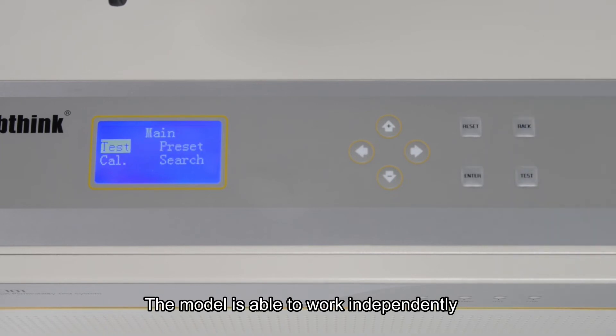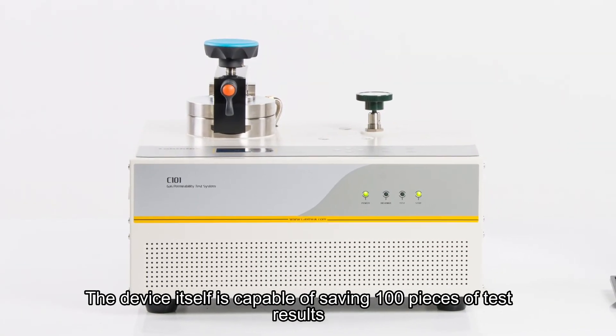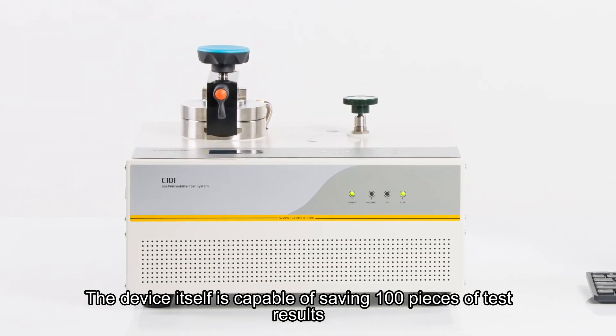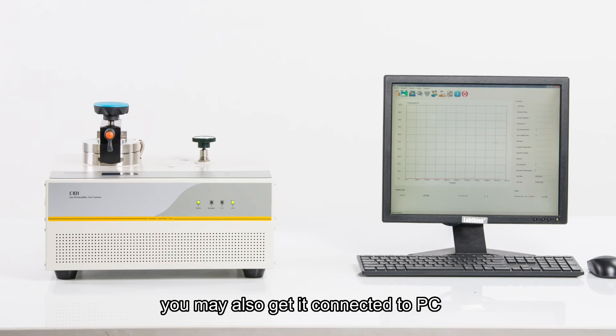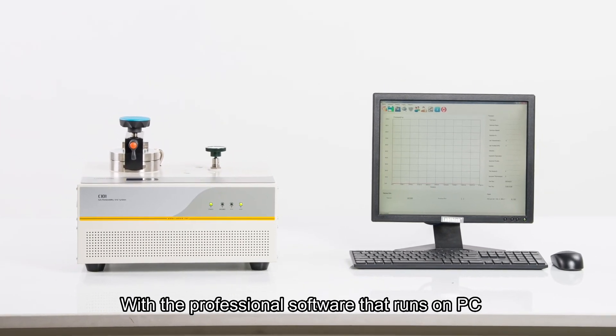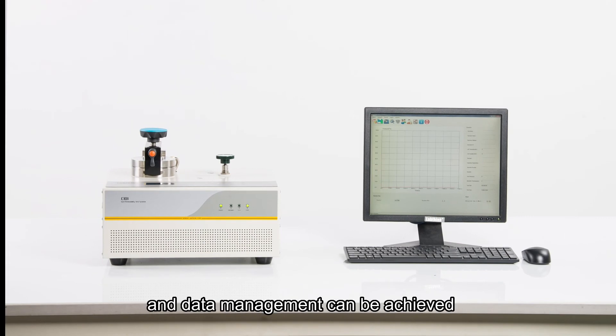The model is able to work independently without a computer. The device itself is capable of saving 100 pieces of test results. Of course, you may also get it connected to PC. With the professional software that runs on PC, more powerful data analysis and data management can be achieved.